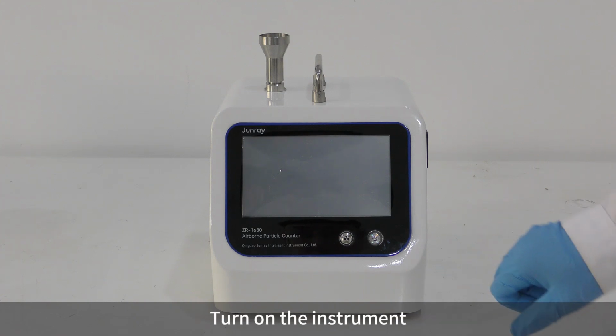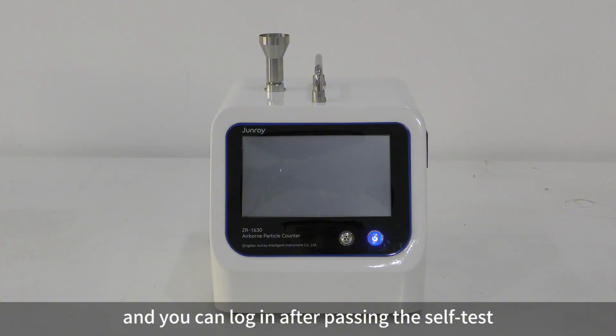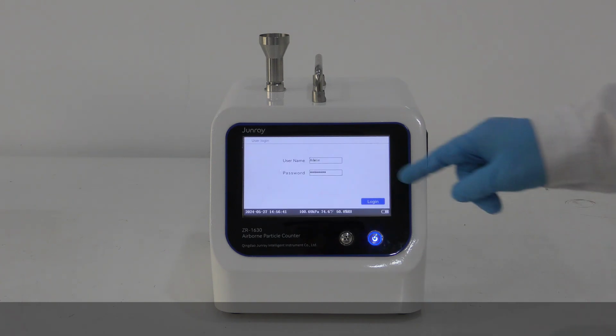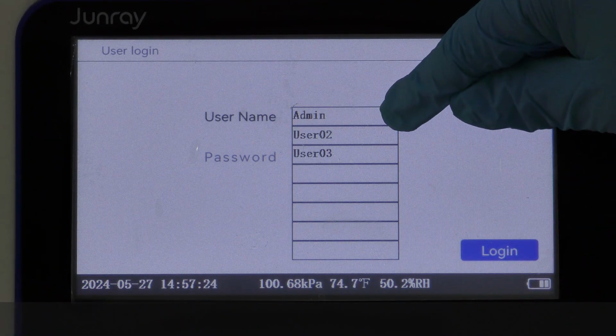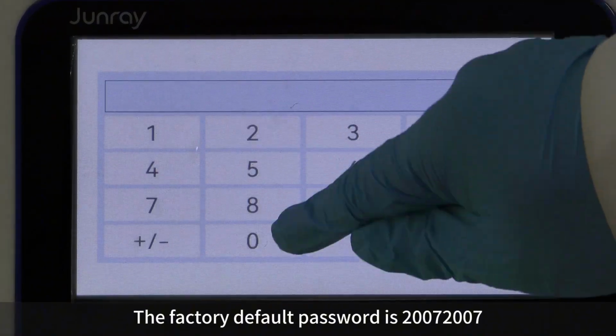Turn on the instrument. It will enter the self-test interface, and you can log in after passing the self-test. Click Username to select the user, insert the password to log in. The factory default password is 20072007.